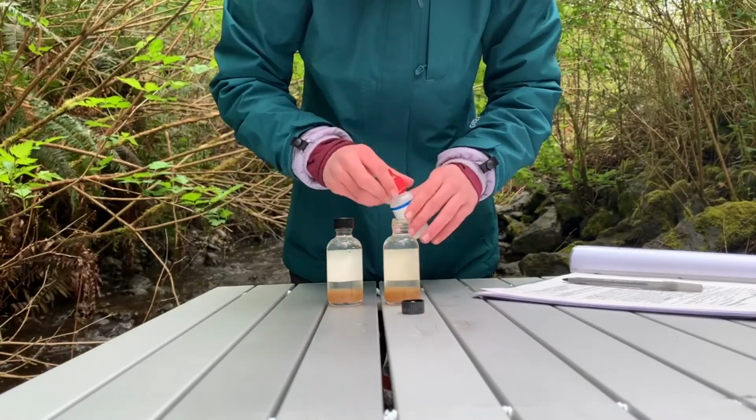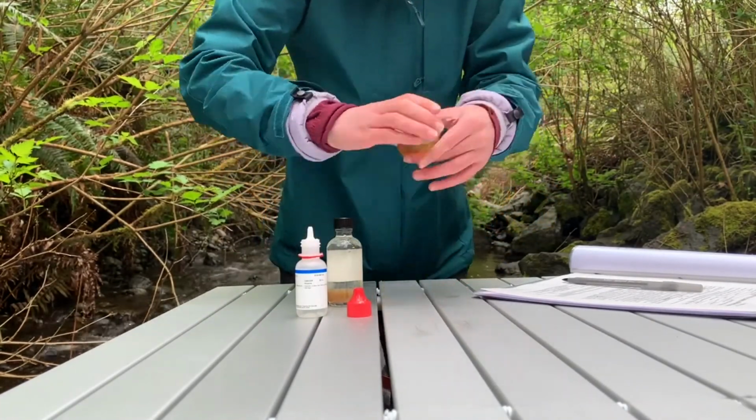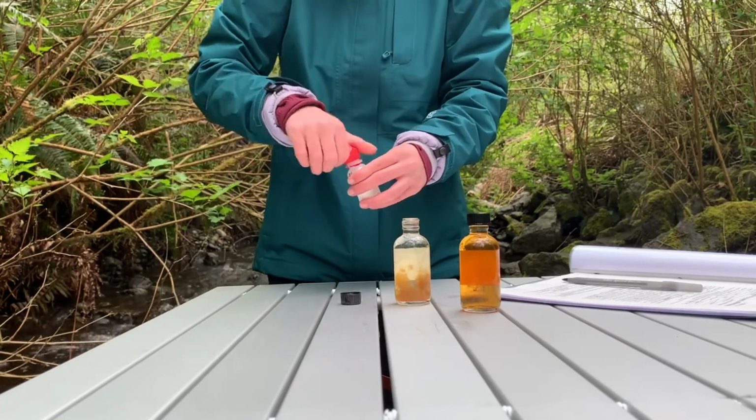Collecting the sample involves completely submerging both sampling bottles until there's no air bubbles trapped inside, which is the most difficult and sometimes cold part of any of the tests we perform. Additionally, it can take some time to fix the samples, so we usually do this test first.